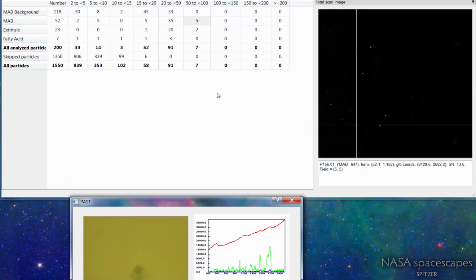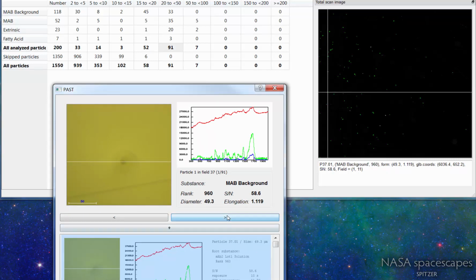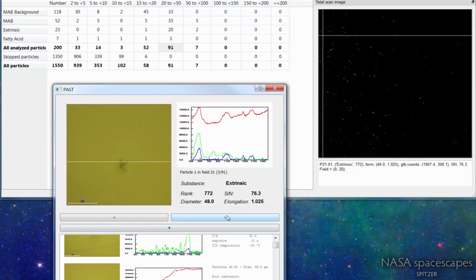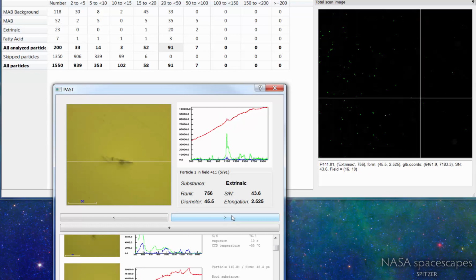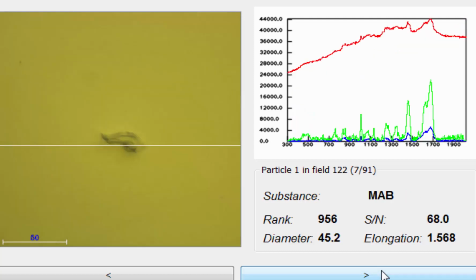Now, more interesting it becomes when we look into that size channel here. Here we see a mixture of, that's just the background signal. That's a monoclonal antibody. That's something extrinsic like cellulose. You see that on the broad peak here. And some monoclonal antibody material, and again some cellulose material. That's how the instrument differentiates one from the other.